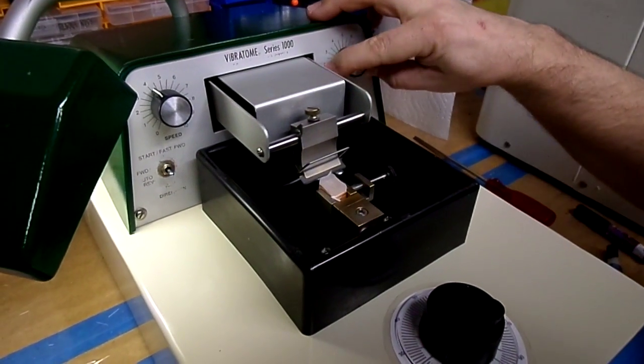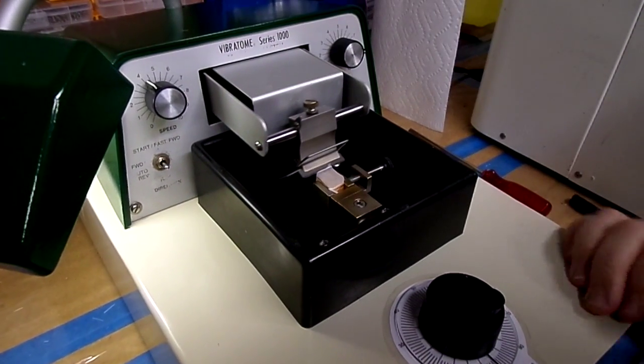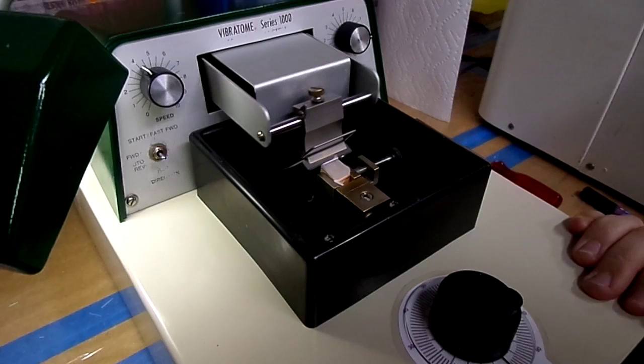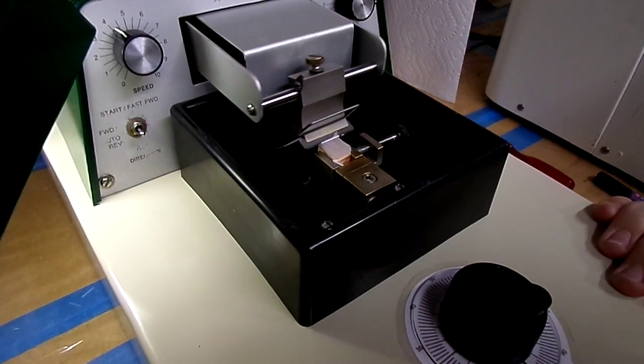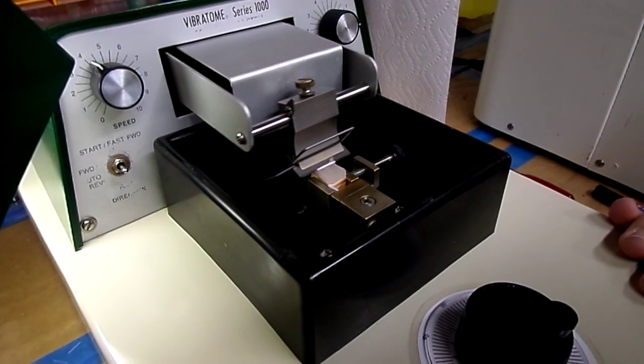So you can hear the amplitude adjusts. I won't mess with the speed right now because we're in the middle of a cut. As you can see, it's cutting a nice little roll there.